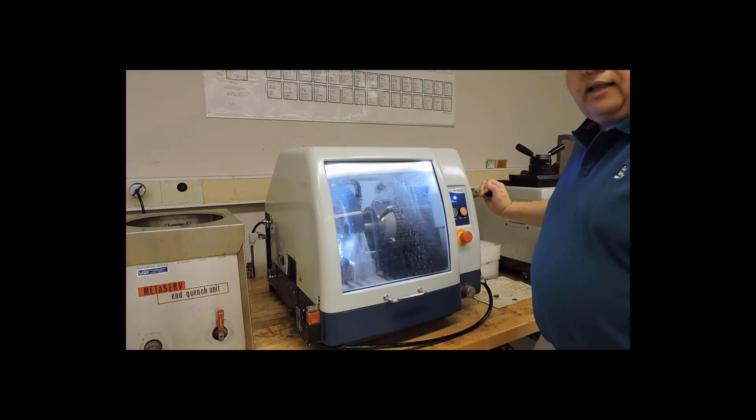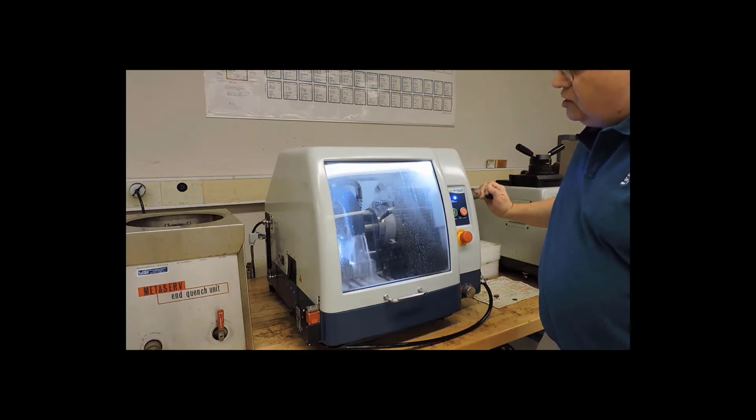Once the blade makes contact with the specimen, some sparks are normal to see. I want to maintain just enough pressure on the lever, 5, maybe 10 pounds at most, just enough that I can feel that the lever is still moving. If I hear the motor start to bog down or the sparks get truly excessive, then I might generate so much heat that I will actually damage the specimen. It should take you on the order of 10 to 15 seconds to cut through the entire specimen.